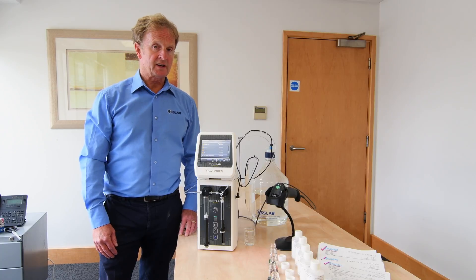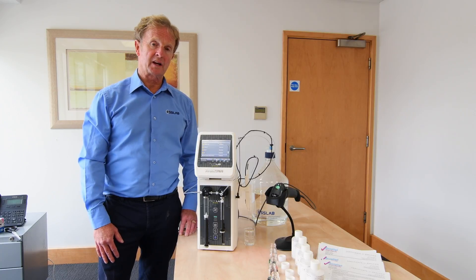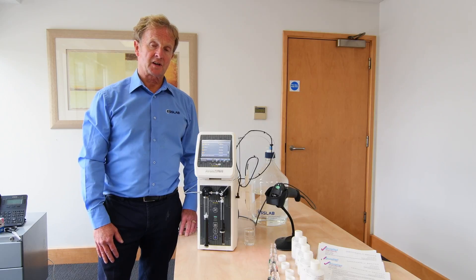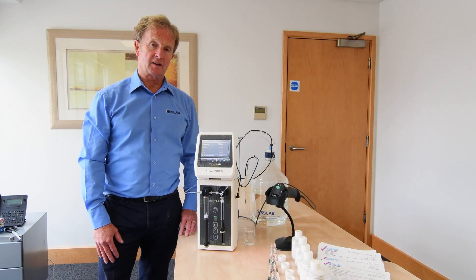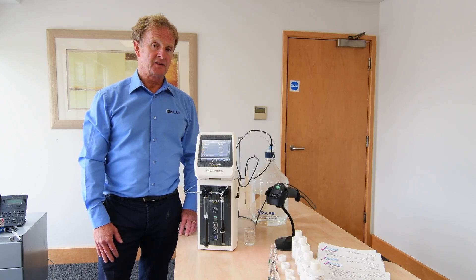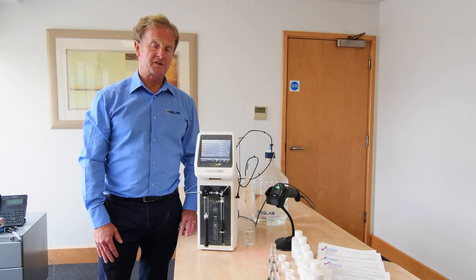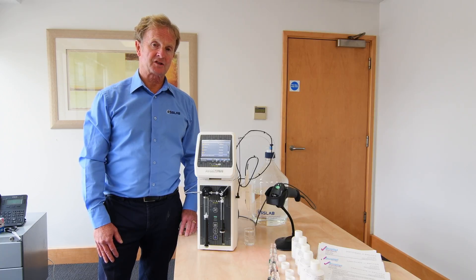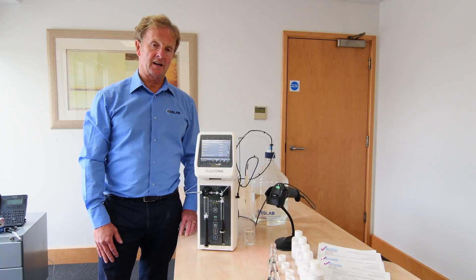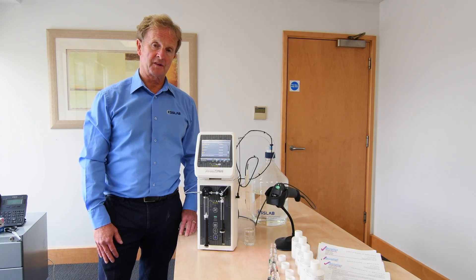As we're not in the laboratory today, we're showing a demonstration using solutions of coloured dyes to allow you to see the movement of fluid. We're also showing some extended functionality of the instrument using additional bolt-on equipment.